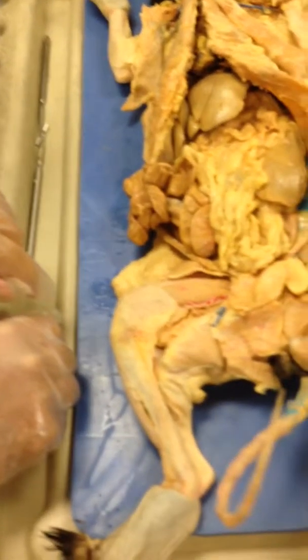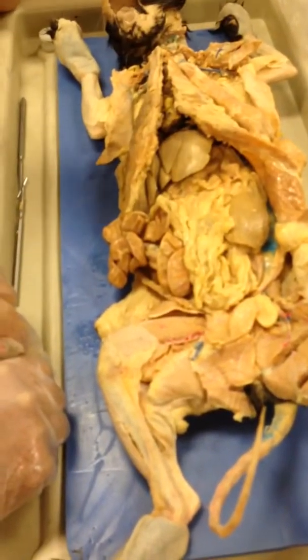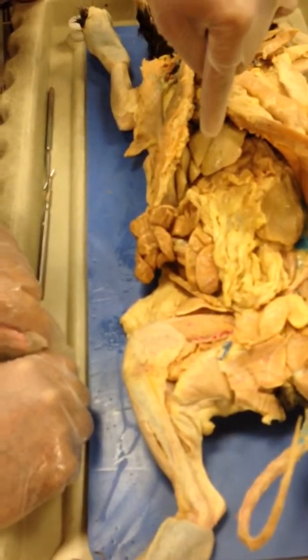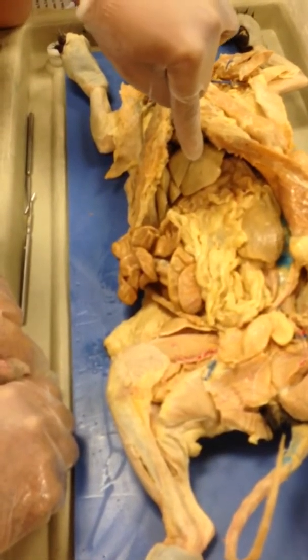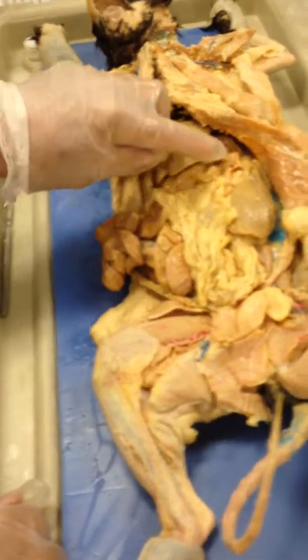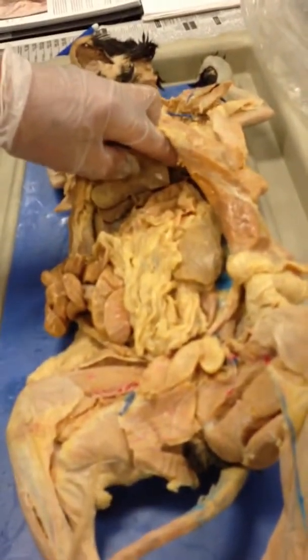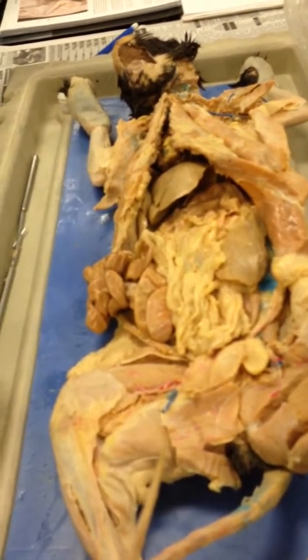Okay. So the stomach part inside, where they actually split it open, this part right here. You have the hiatus inside. No, that was the sphincter. I was going through the stomach, up through the esophageal hiatus into the esophagus. So you would know that.